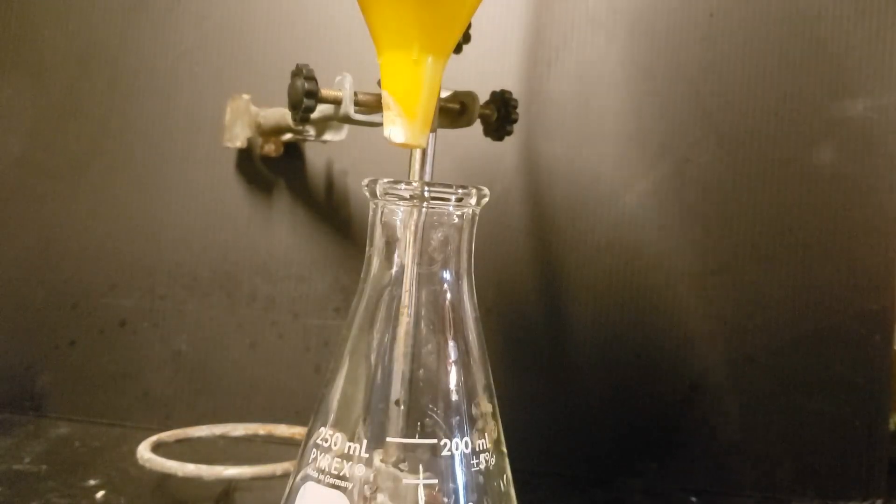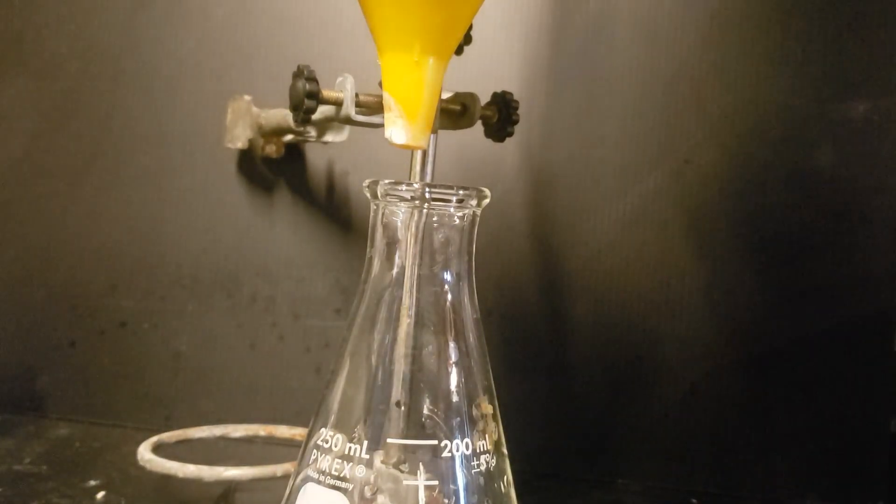The next day, these crystals were filtered off and washed with about 50 milliliters of ice cold acetone.